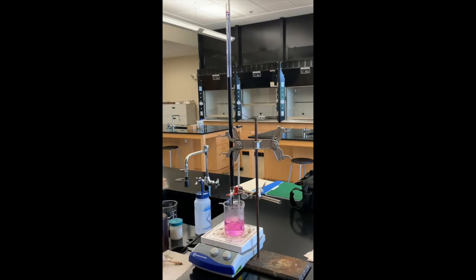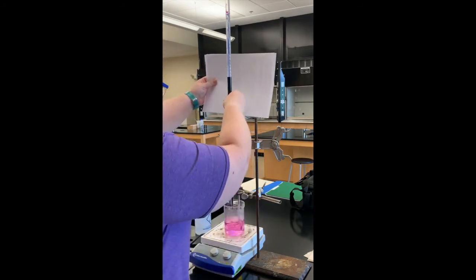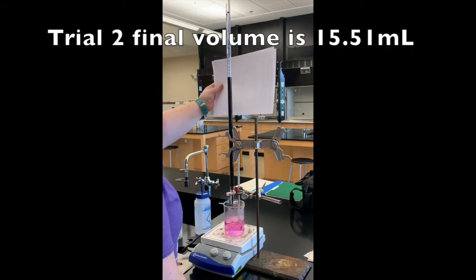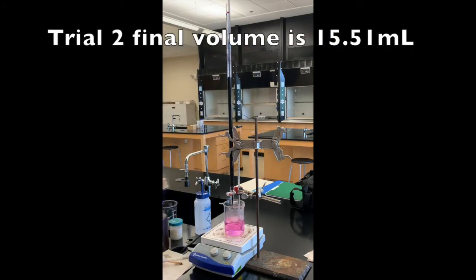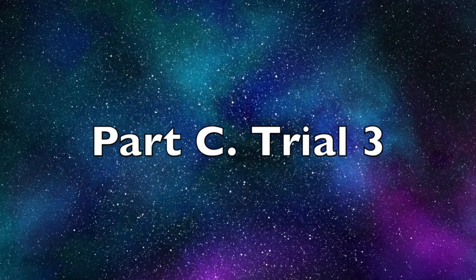Okay, so we have reached our endpoint. The final volume in our burette now is 15.51 milliliters. And so we are ready to move on to trial three.